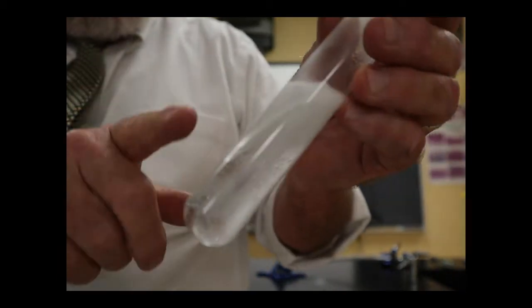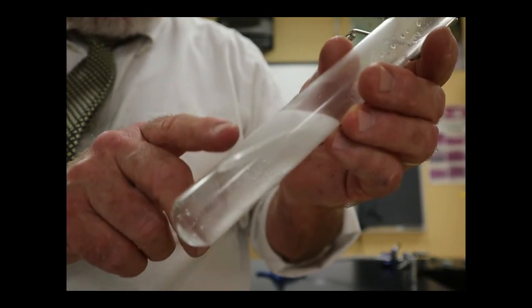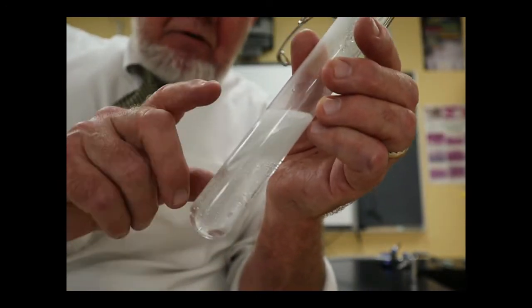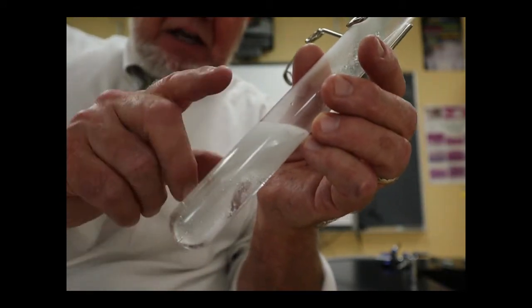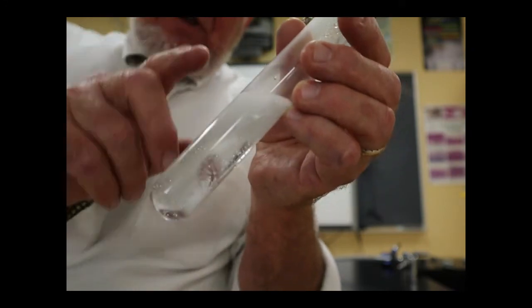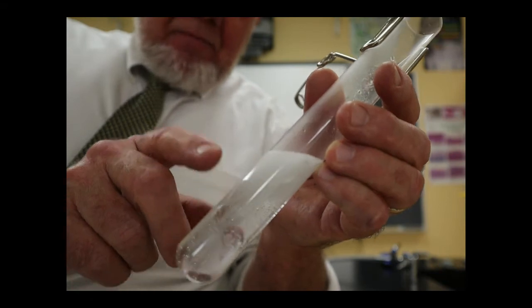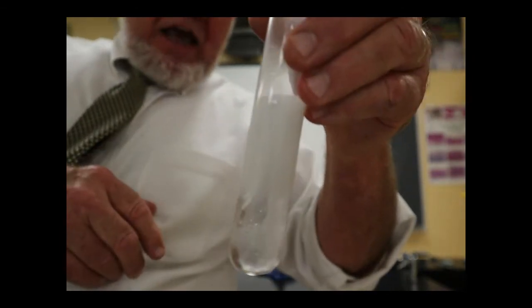At any rate, what I want to do is get all that magnesium dissolved. When it's all dissolved in solution, I'm going to have a compound that will be magnesium chloride, and it will be dissolved in the water. Now, the hydrogen gas is bubbled away, and hydrochloric acid has hydrogen chloride and water, so there's going to be lots of water. And what I want to do is get rid of the water so that I can obtain the white compound that I have formed here, the magnesium chloride. And so that means I'll have to evaporate off the water. And that's why I'm trying to be careful about not using too much of the acid.